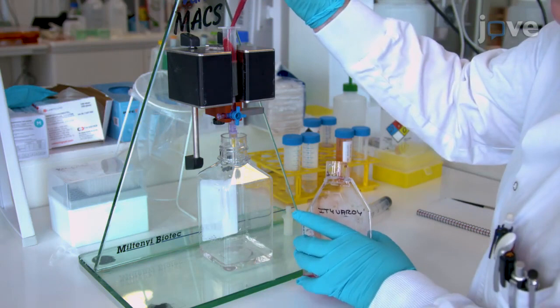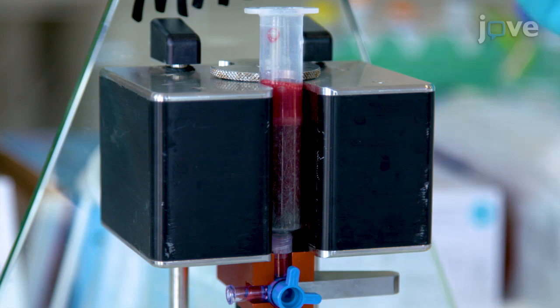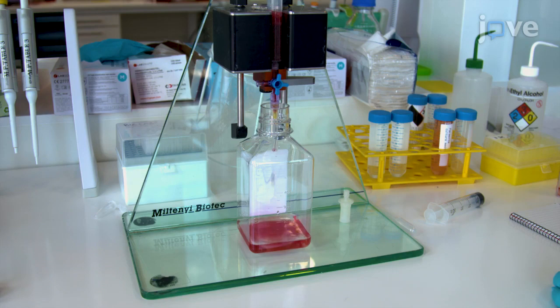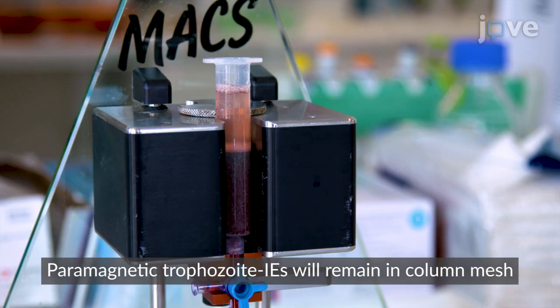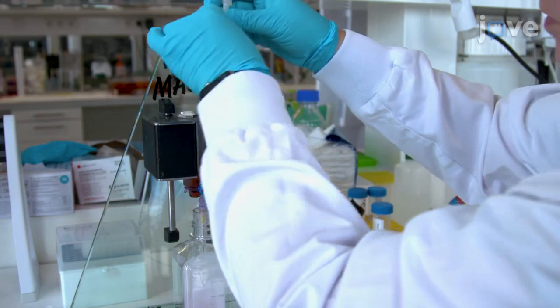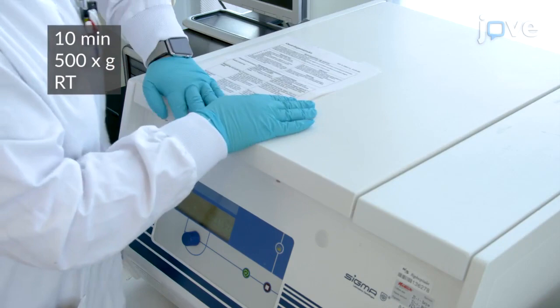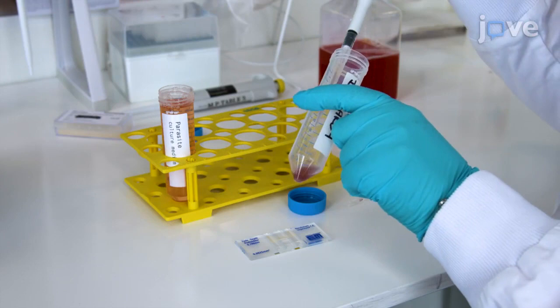For mid to late stage trophozoite infected erythrocyte harvest and purification, prepare around 1.2 milliliters of packed P. falciparum parasite culture in 10 milliliters of parasite culture medium with at least 5% parasitemia, and add to a magnetic column. Wash the column with 50 milliliters of parasite culture medium. To elute the infected erythrocytes, remove the column from the magnet and flush it with 50 milliliters of parasite culture medium. Then collect the infected erythrocytes by centrifugation and resuspend the pellet in 1 milliliter of fresh parasite culture medium for counting.